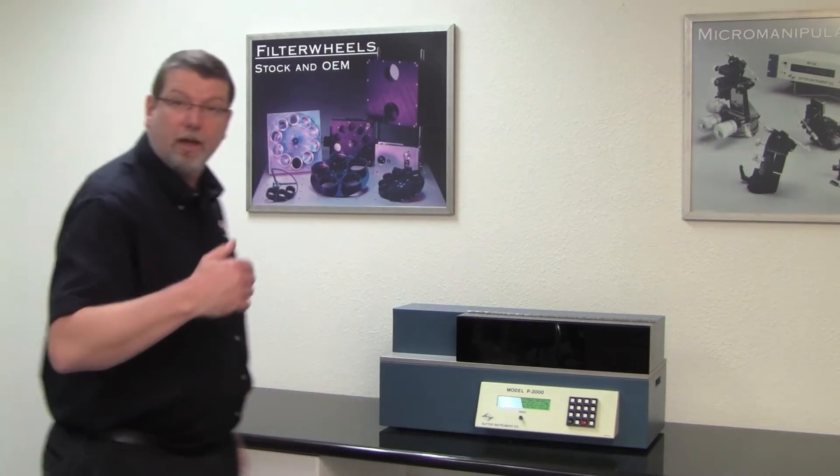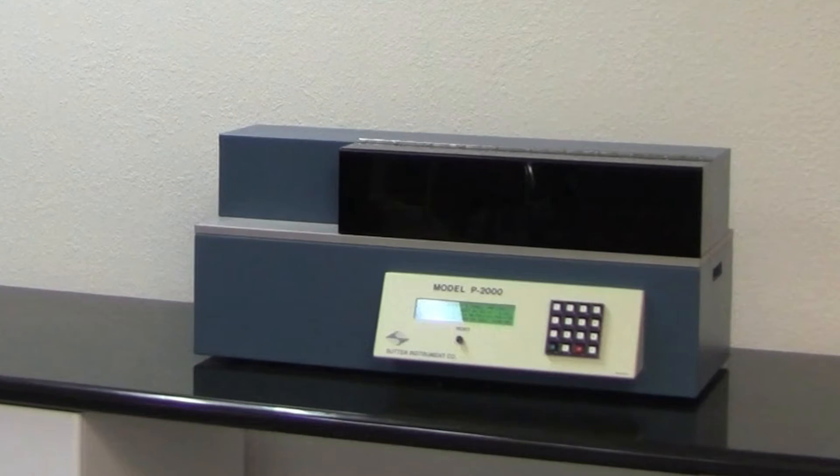Since you're watching this video, you've probably done this two or three times before. Therefore, let's now move into our laser safety lab and take a look at things the way you haven't seen them yet.